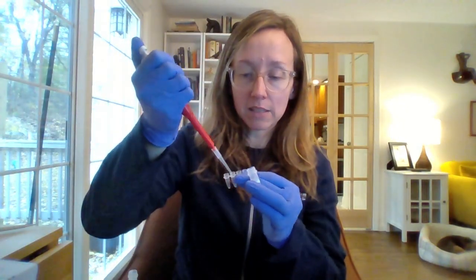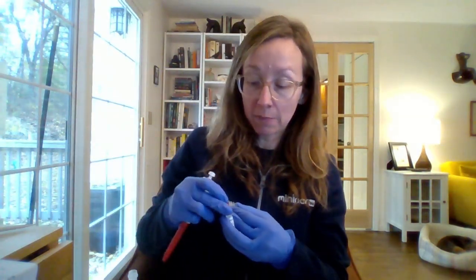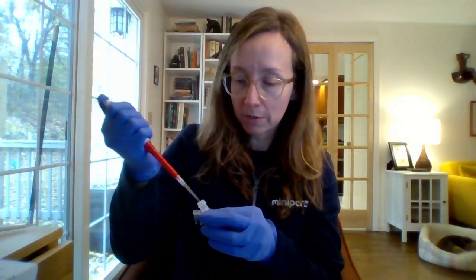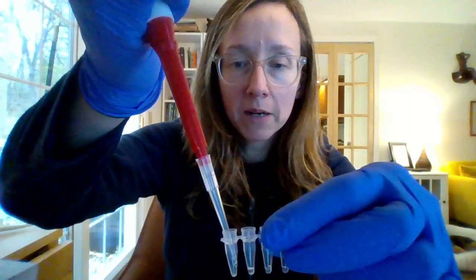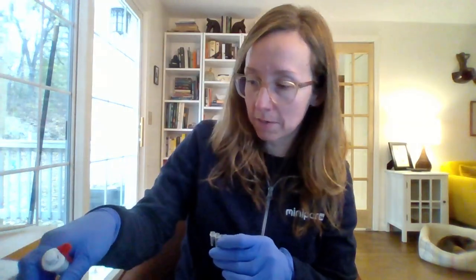So I'm just pipetting onto the side wall of each tube. And then I'm letting the droplet kind of roll down and hydrate the pellet. And I'll show you what that looks like here on my next tube. So I've got 1 tube left to set up, tube number 4. I'm going to try to do it so you can see what's happening. So this tube is the one I'm pipetting into. I'm taking my pipette tip, I'm just having it kind of sit next to the side wall of the tube. I'm pipetting the droplet onto the side wall and letting that droplet roll down onto the pellet. That's the technique you want to use when you're pipetting into BioBits pellets anytime.